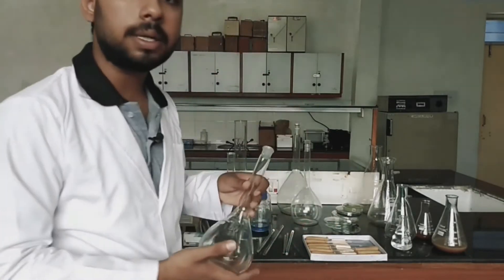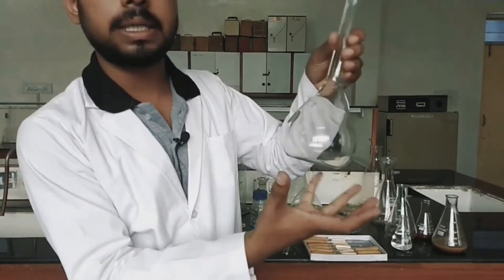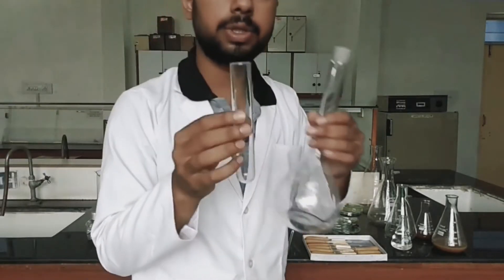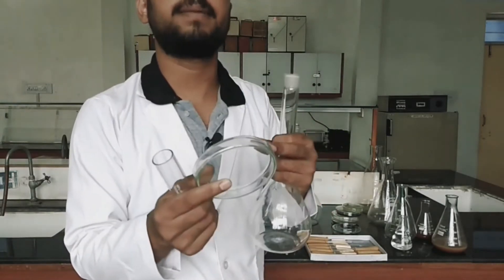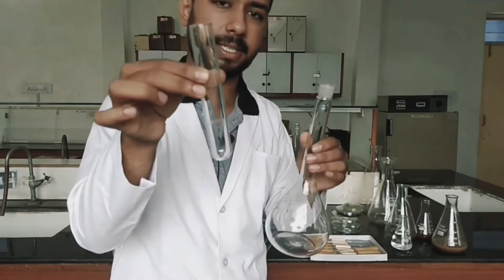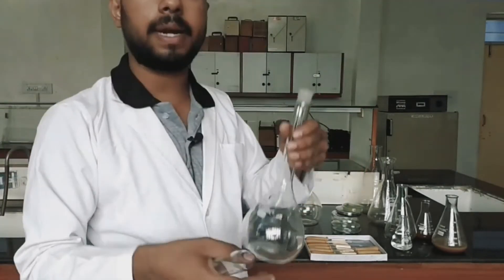Next one is the round bottom flask. The bottom is round, that's why it is called a round bottom flask. It contains a narrow neck. When we put culture media or any type of solution in it, due to this narrow neck, most contamination is reduced. The same principle applies to test tubes — test tubes have a lower surface area, which is why we preserve cultures in them rather than in petri plates, which have a larger surface area and thus higher contamination chances. These flasks allow us to make large amounts of culture media while preventing contamination.